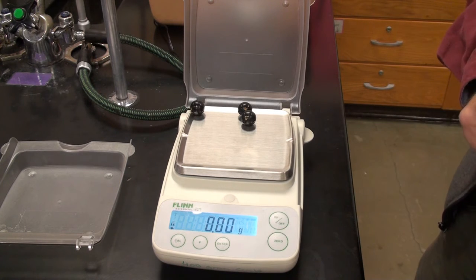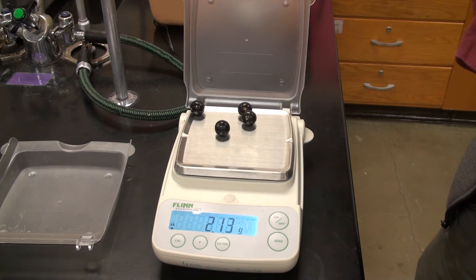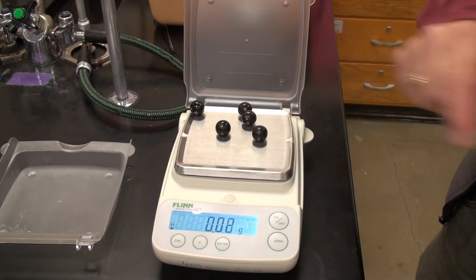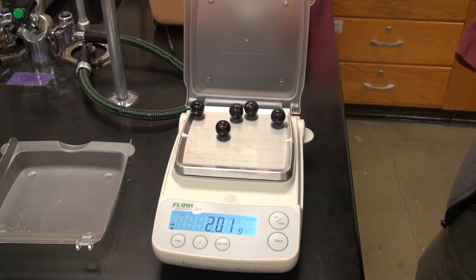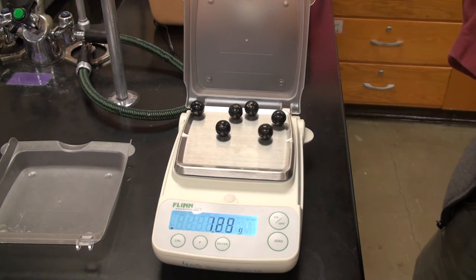All right, zero it. Here's the fourth one. Zero it. Here's the fifth one. Zero it. Sixth one.